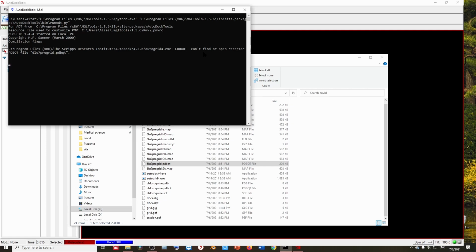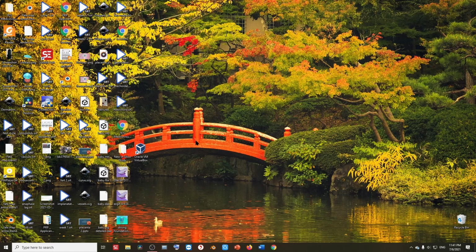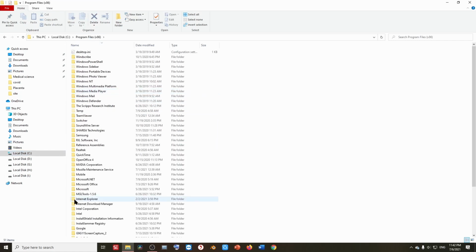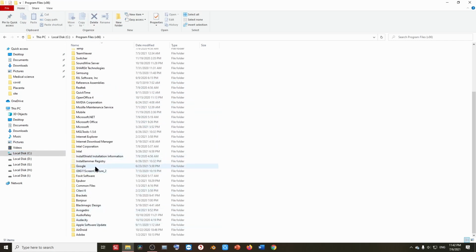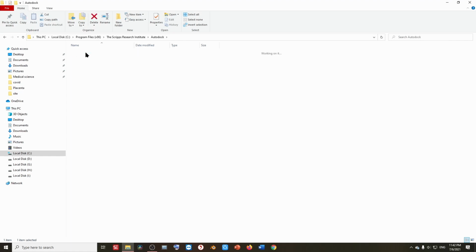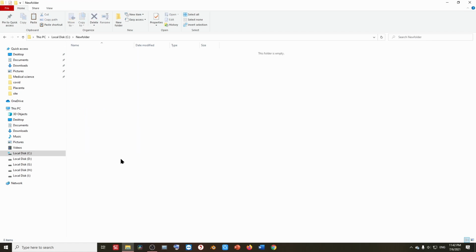The solution is very easy. Let's first close everything. Now let's go step by step. First, let's go to C, Program Files x86, and here is the Scripps Research Institute. Let's copy these two executables and paste them somewhere in a folder which does not contain any space. The folder name should not contain any space. Paste it in that folder and then try to open it from MGL tools.